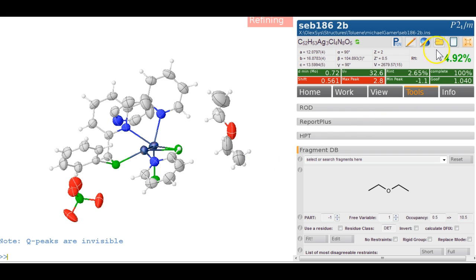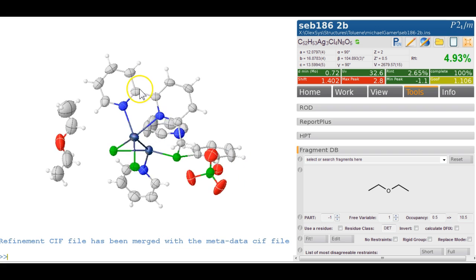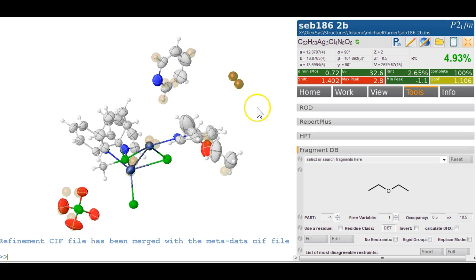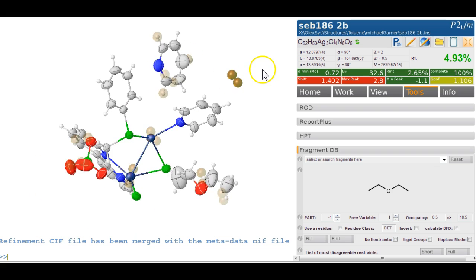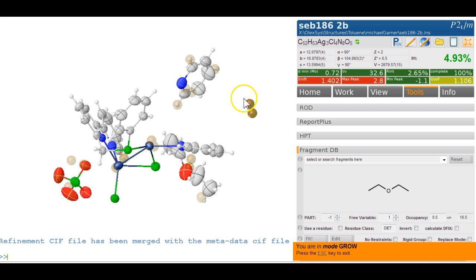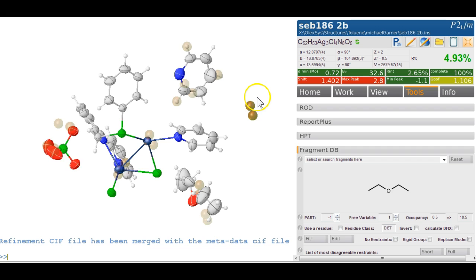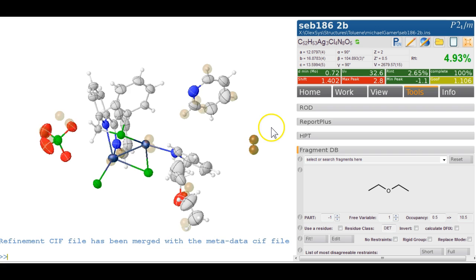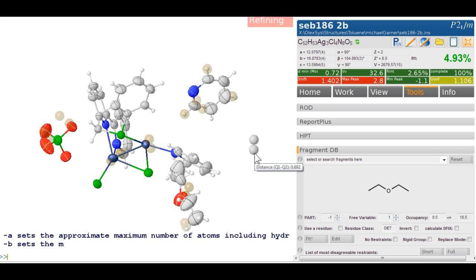That doesn't look unreasonable. The R factor of 4.9% at the moment. Things are obviously moving, but that's to be expected. So let's add hydrogens to this pyridine, H-add, and have a look at what we've got left in terms of Q peaks. So there's something else in here, and that looks like it's going to be trouble. Control G, Control grow, nothing really grows here. We've got a lot of peaks already showing, and this doesn't grow. So this is an interesting one. So what I suggest to do in this case is just put 2 carbons in here and see what we end up with.